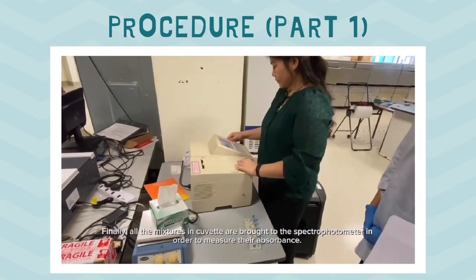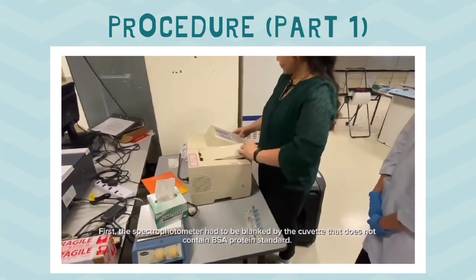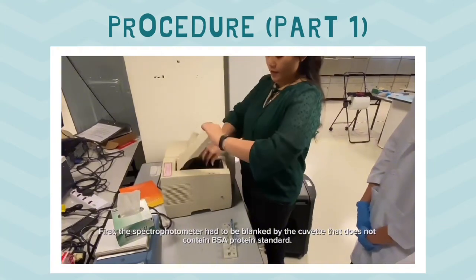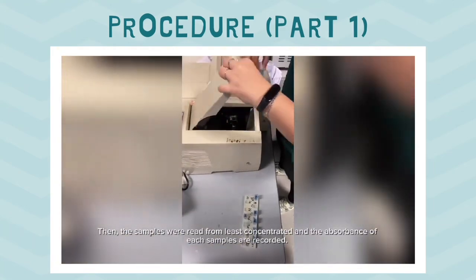Finally, all the mixtures in the cuvette are brought to the spectrophotometer in order to measure their absorbance. First, the spectrophotometer had to be blanked by the cuvette that does not contain BSA protein standard. Then, the samples were read from least concentrated and the absorbance of each sample was recorded.